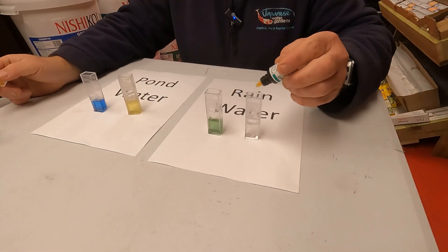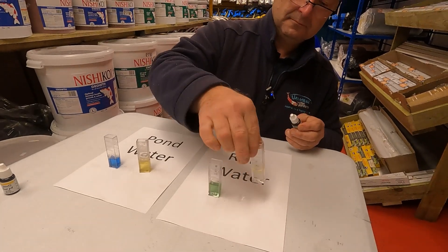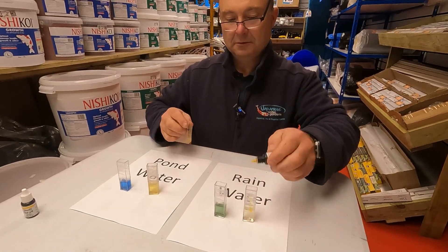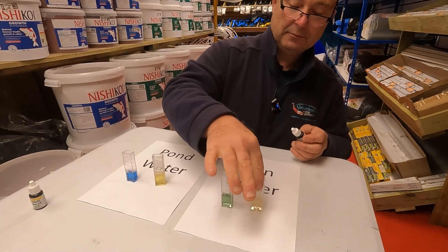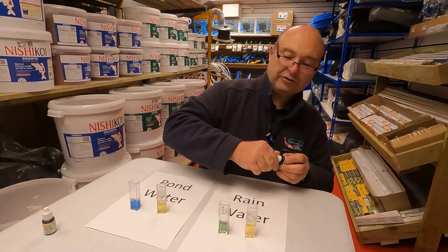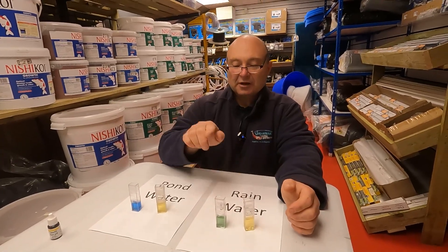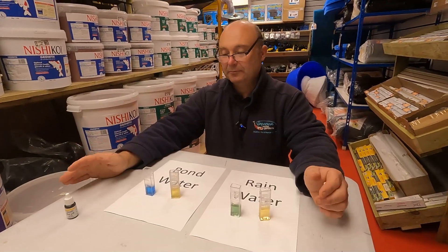Let's test the rainwater. 1 drop... 2 drops are in and it's turning yellow. So the rainwater has an extremely low level of carbonate hardness. That means that if you were to use a lot of rainwater in your pond, you could experience some pH problems.